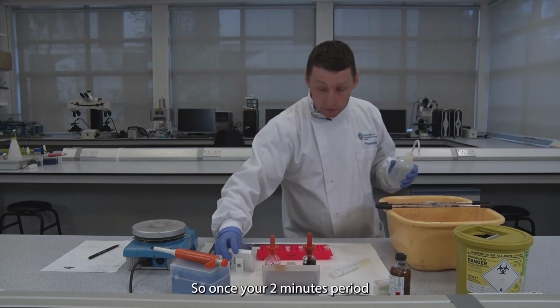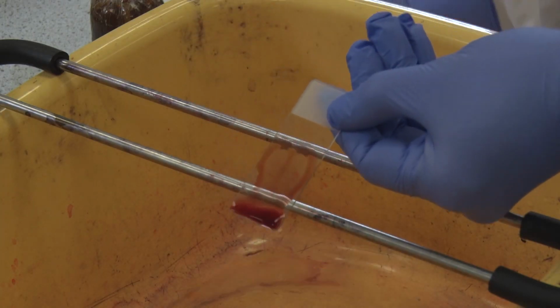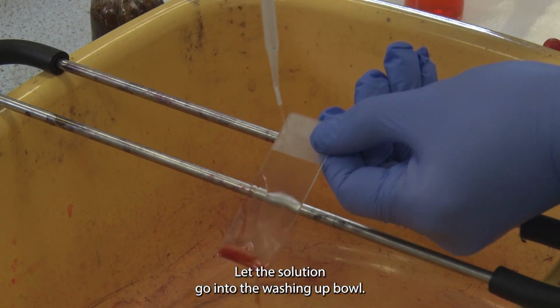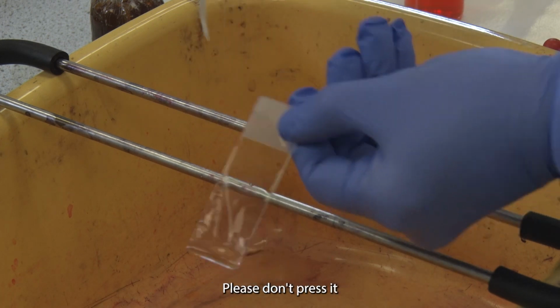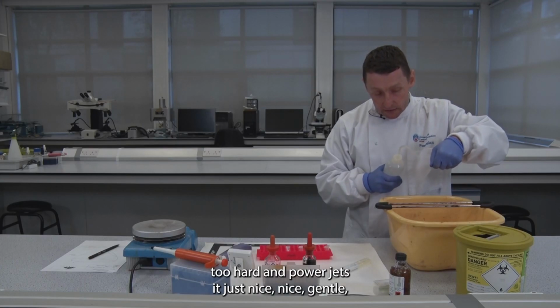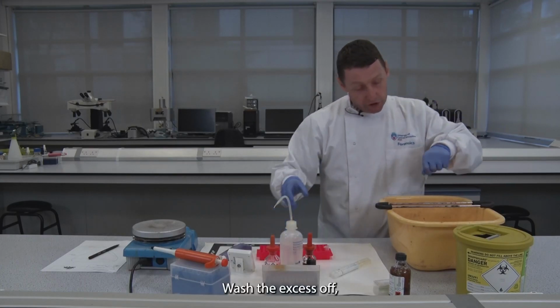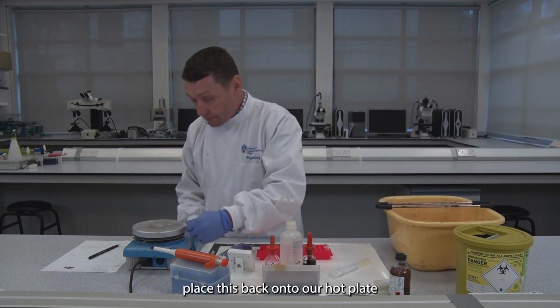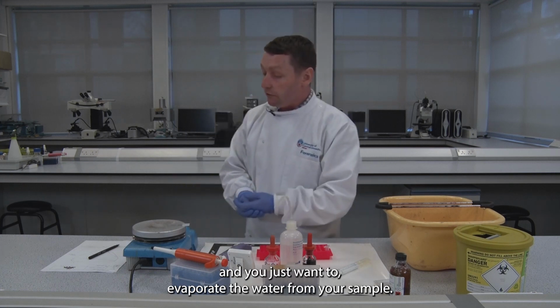Once your 2 minute period is up, hold your slide up face down, and let the solution go into the washing up bowl. Nice gentle wash. Again, please don't press it too hard and power jet it. Wash the excess off. Place this back onto our hot plate, and you just want to evaporate the water from your sample.